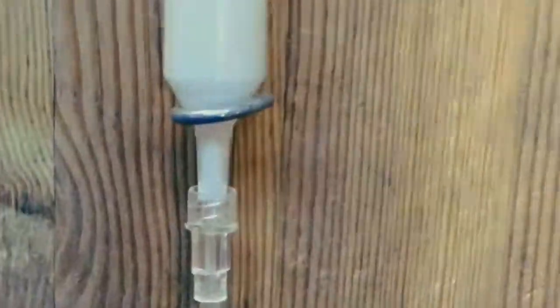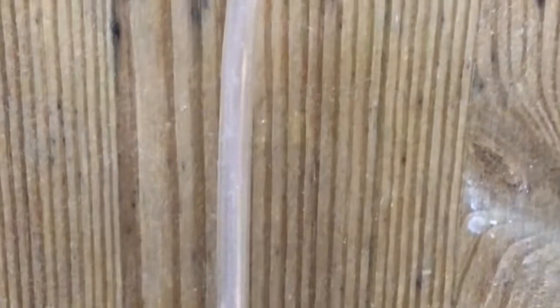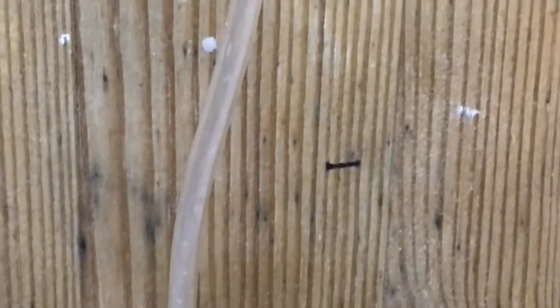Fill the dried silica gel in the column. Make sure the beads are distributed evenly. If not, just tap it a little.